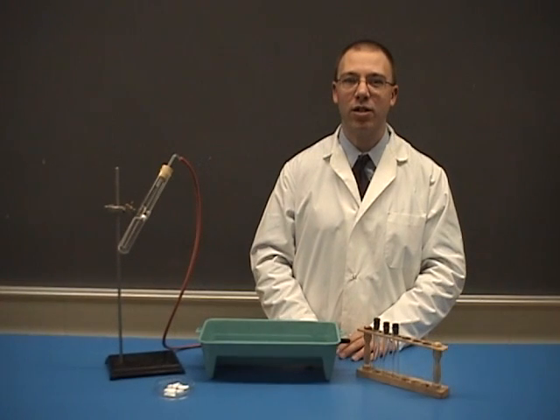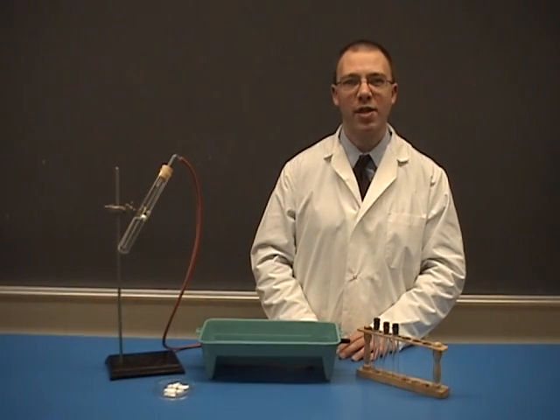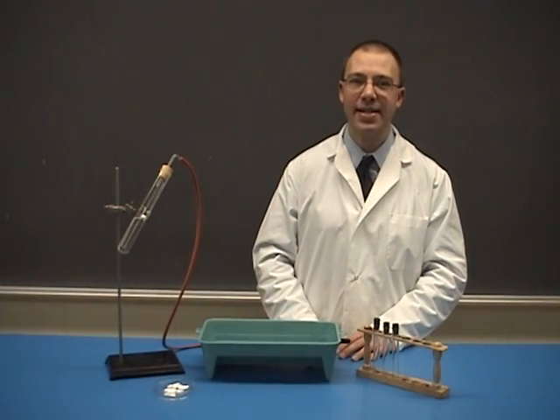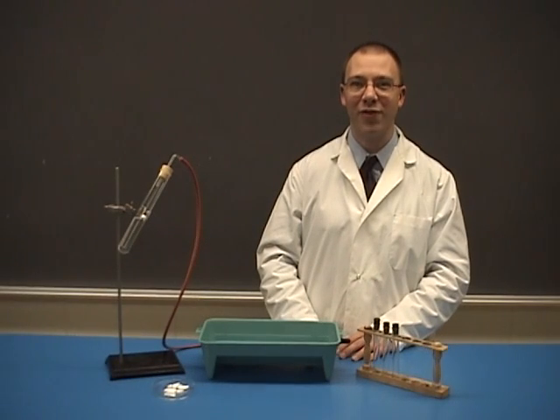Two gases may seem identical, but how can we collect them, and how can we test them to be sure? The objective of this lab is to collect an unknown gas, and later you can identify it.